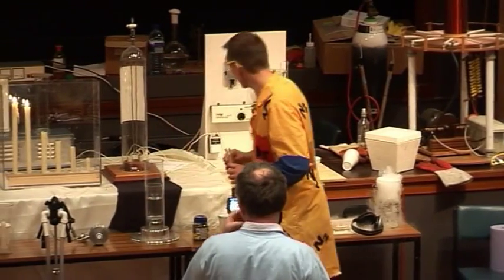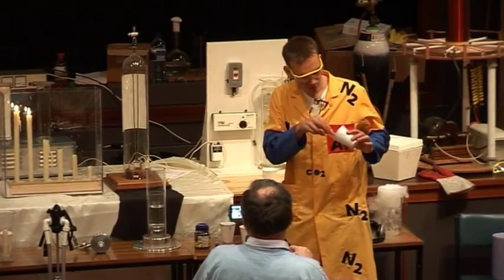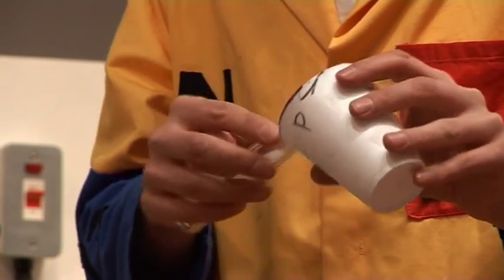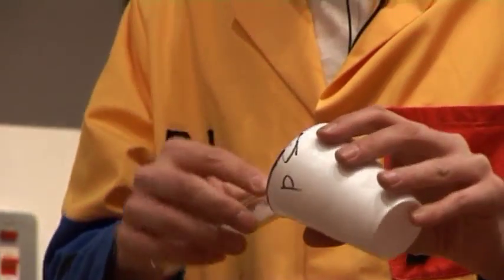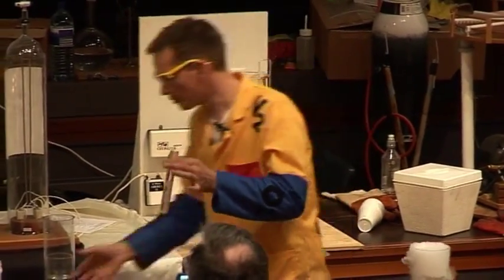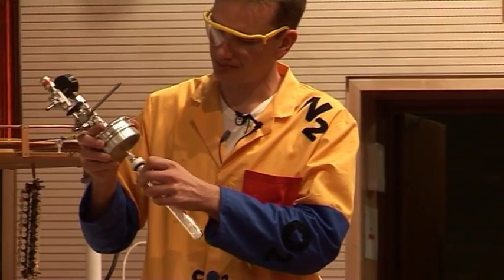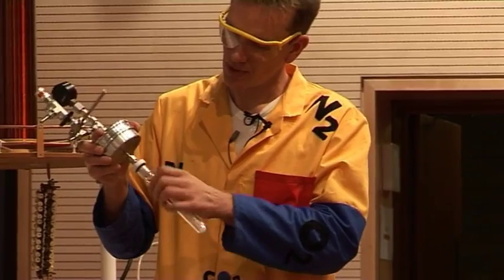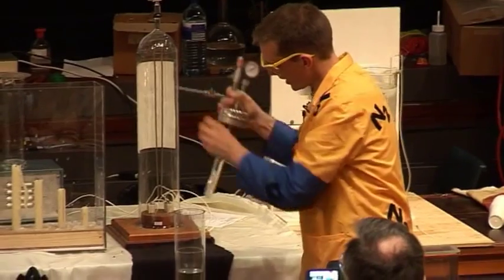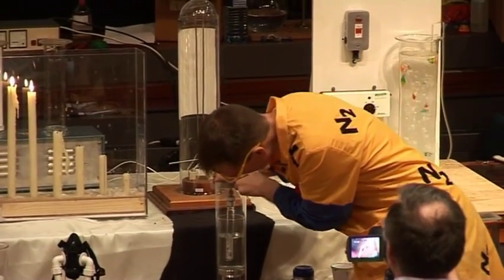And if we're careful, we can still make some liquid carbon dioxide, and this is what I'm going to try and do now. I'm going to put some of the solid carbon dioxide into this very, very thick-walled test tube. So here I have some solid carbon dioxide in the test tube. I'm going to put the lid on and do it up, and put this into some water here so it doesn't frost over.